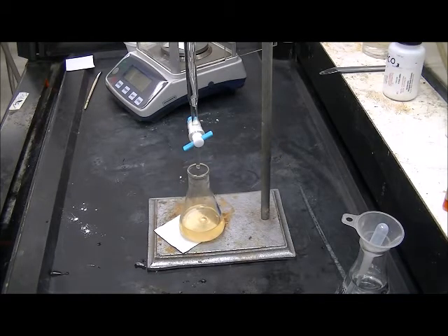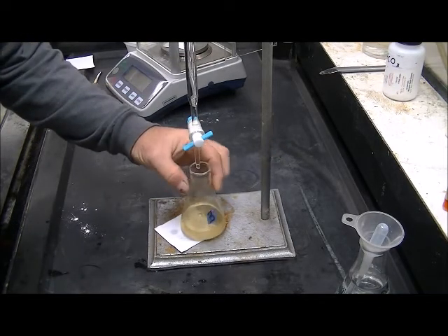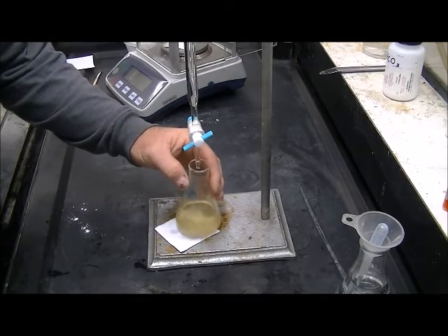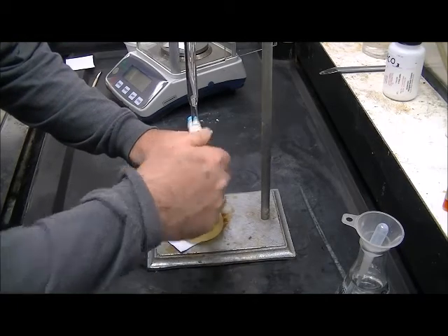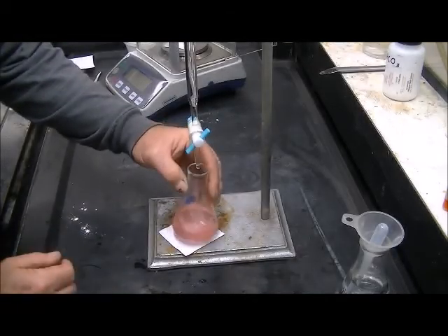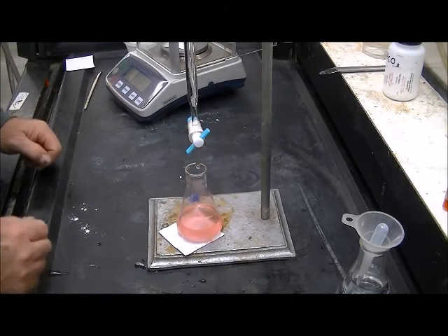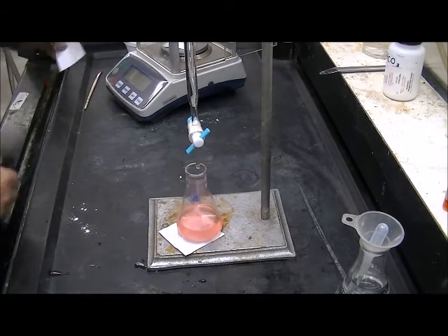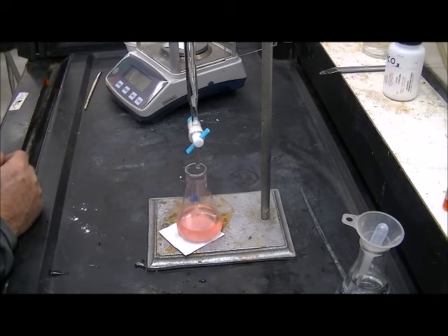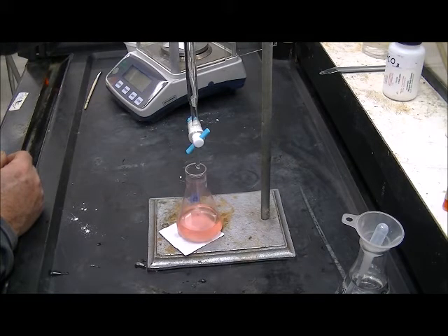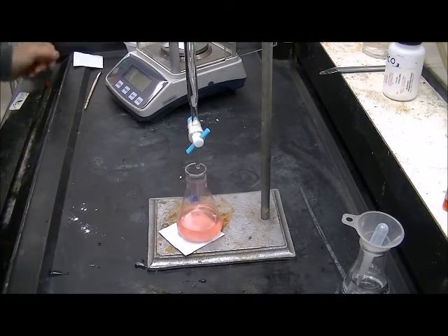And this is the third sample of unknown D. Okay, unknown D, sample 3. And the number is 33.2 milliliters.